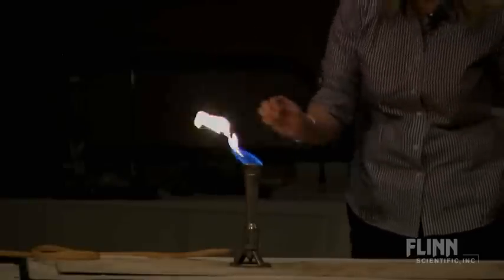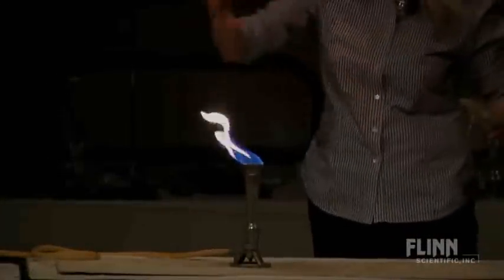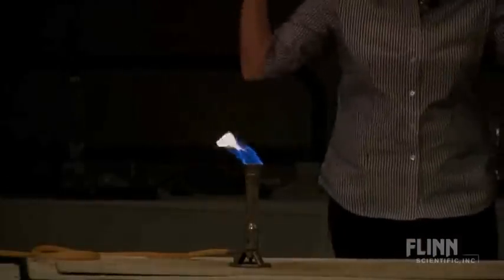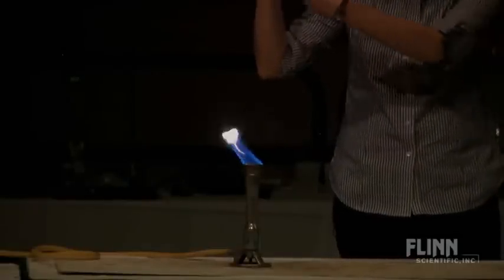Notice it's just cool fireworks. Why is it white? Because it's reacting so much faster. Periodic table: iron, titanium, magnesium.